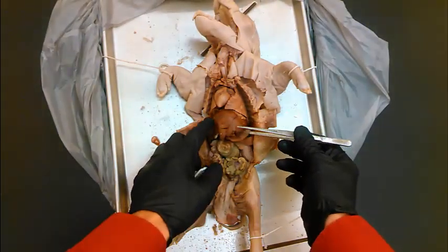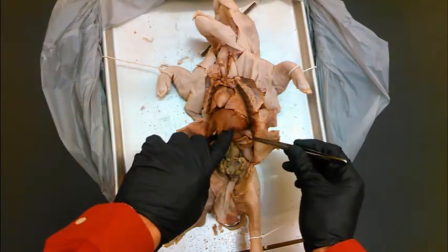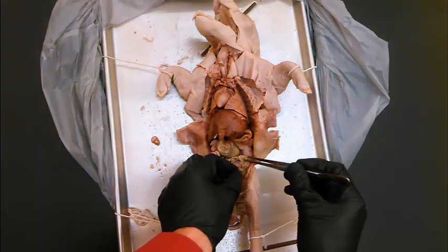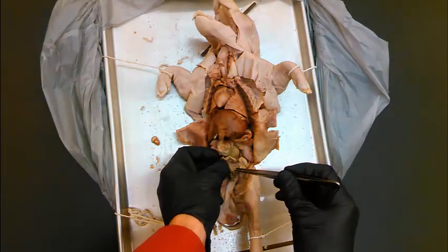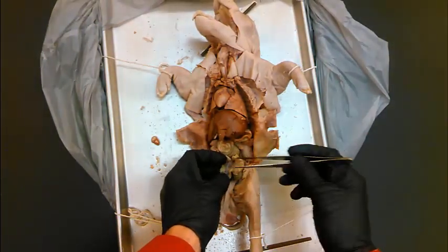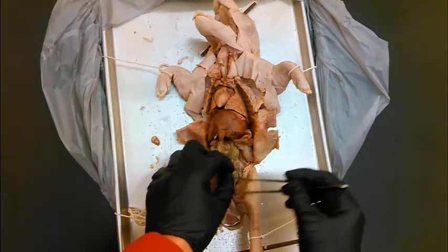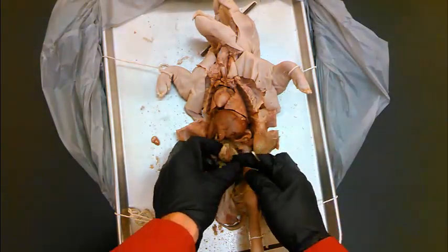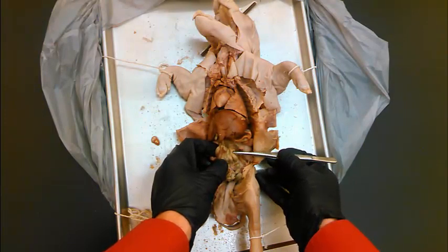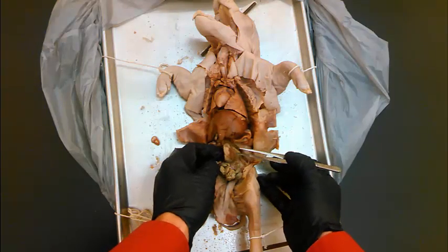This is the liver — the big thing up here. The stomach is under the liver, right here. We've also got small intestine — all of this is small intestine. You can see this membrane that connects the intestine to the back of the abdominal wall — that's mesentery. So that's small intestine. This is the pig's large intestine, also known as a spiral colon. On this one we can nicely see these little segmented bulges — those are called haustra. Haustra of the large intestine or the colon.